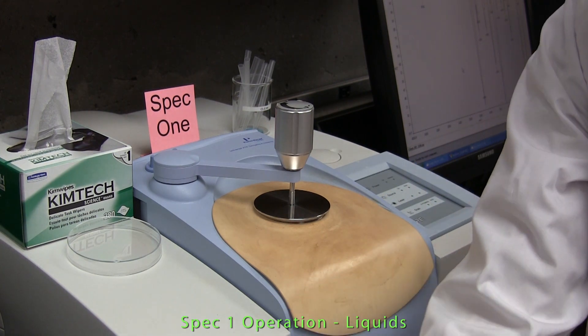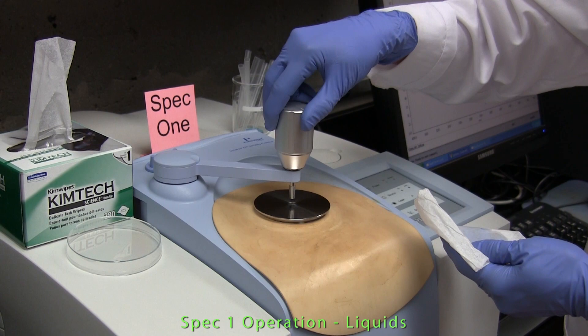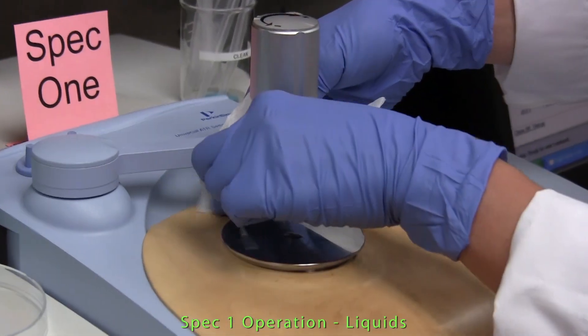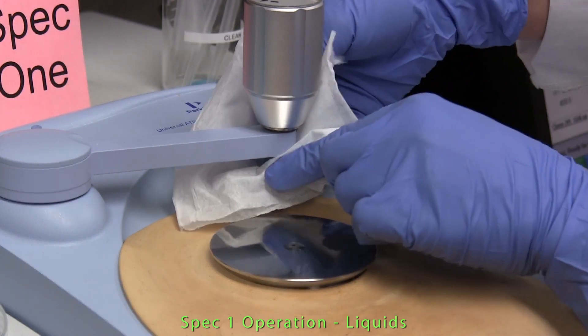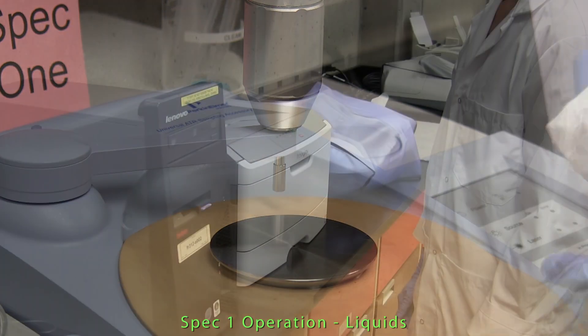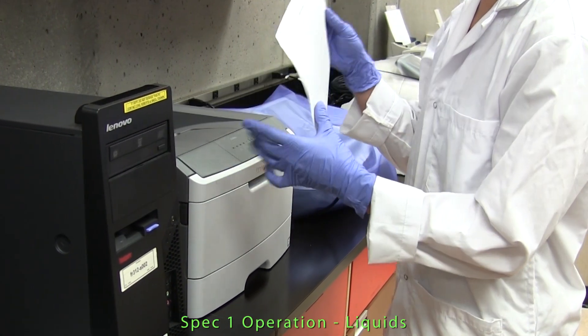Use an alcohol-moistened tissue to clean the surface of the crystal and mounting plate. And again a hard copy of the spectrum is obtained from the printer.